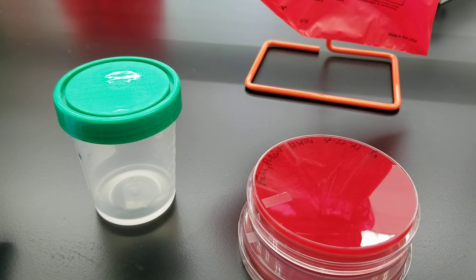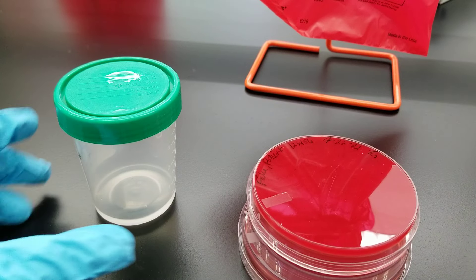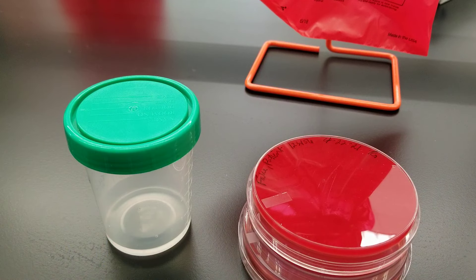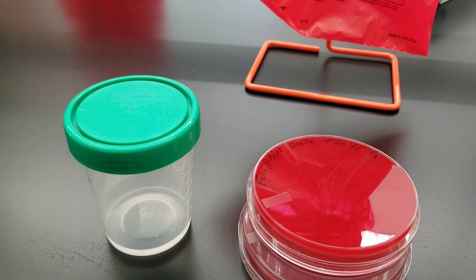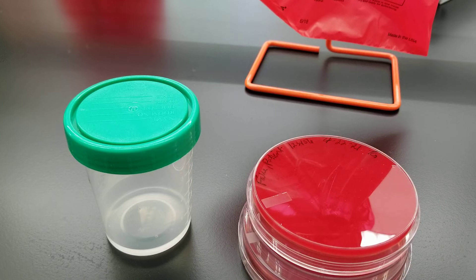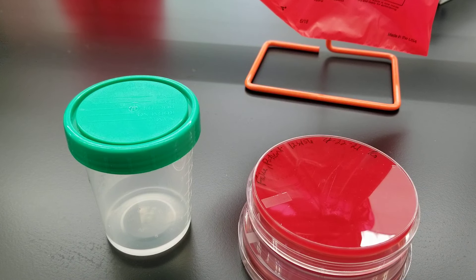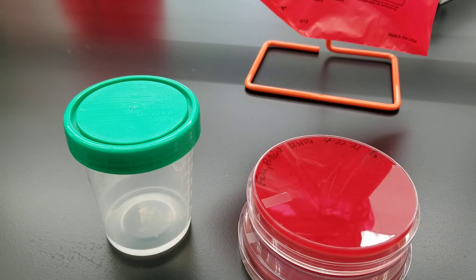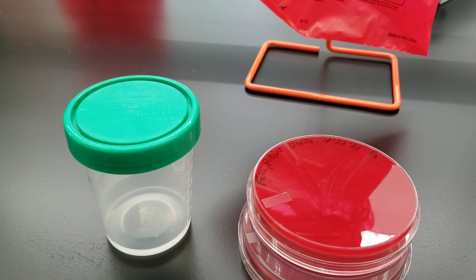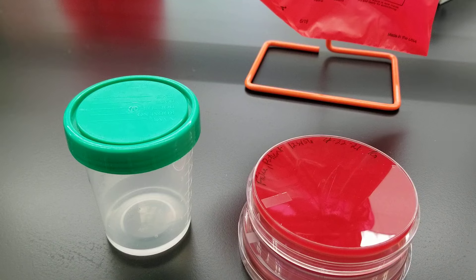Hi everyone, today we are going to be streaking a urine culture and also performing a colony count after 24 hours of incubation. The purpose for this is to try to figure out how many bacteria and what type of bacteria are in a patient's specimen, and that's clinically significant because it could indicate a urinary tract infection.